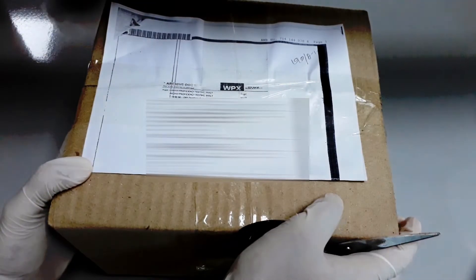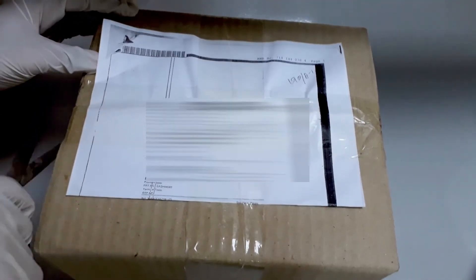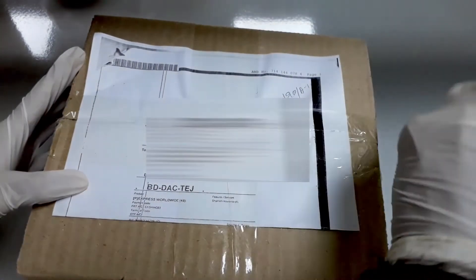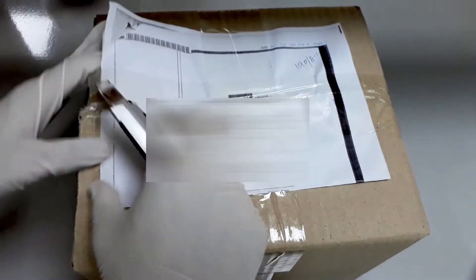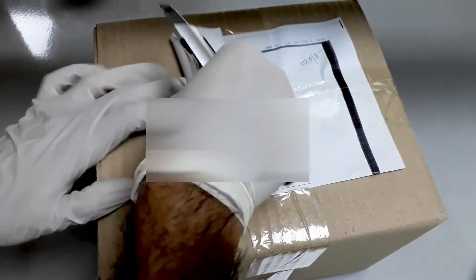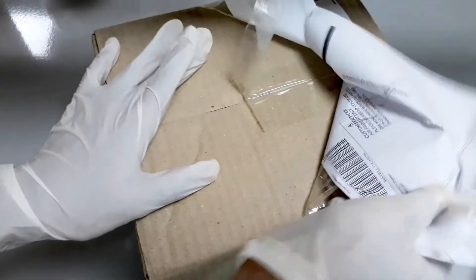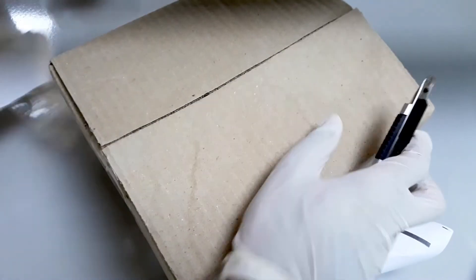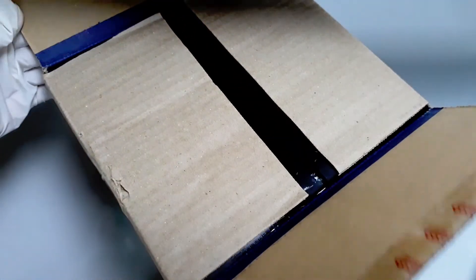This is the box of the PT sample. We just received it from the courier service. Let's open the box. An address tag is attached on top of the box, which is used by the courier service to deliver the parcel. Let's see what is inside the box.